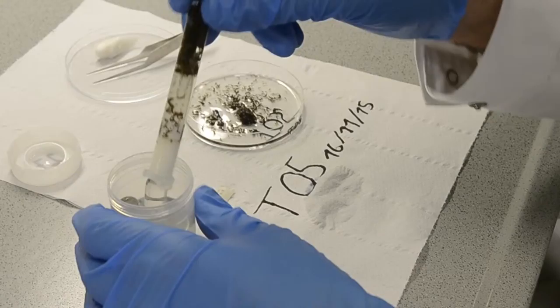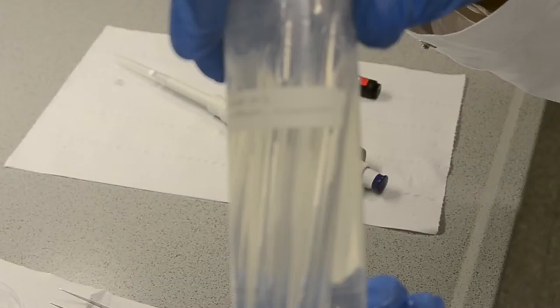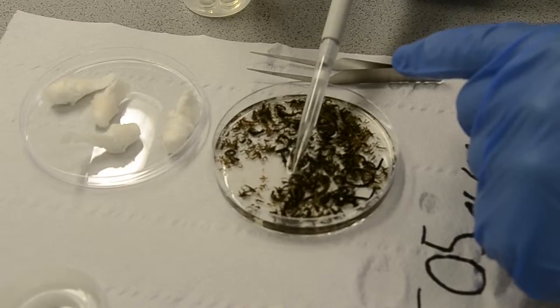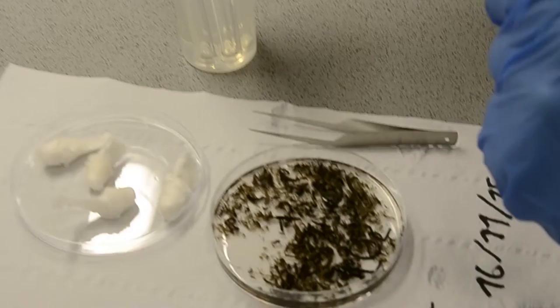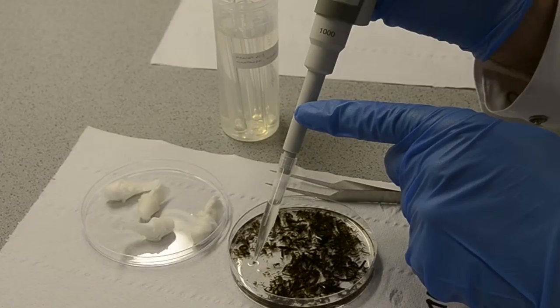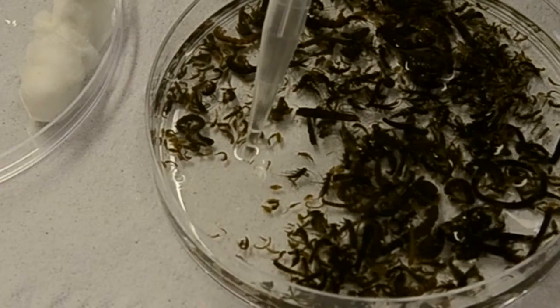We proceeded in the same manner for all the glass tubes from that sample. I am done now putting all the specimens from this one sample site onto the Petri dish and I am using a sterile pipette tip to make me some space. Now I can proceed and carefully remove the ethanol by pipetting from the specimens. I put the ethanol back into the original sample tube.